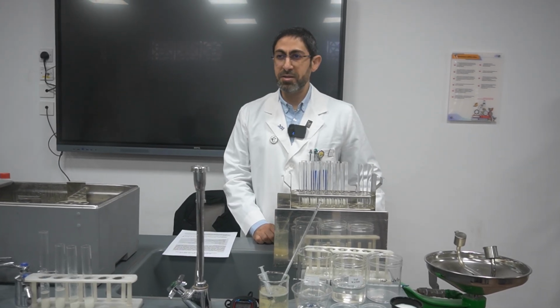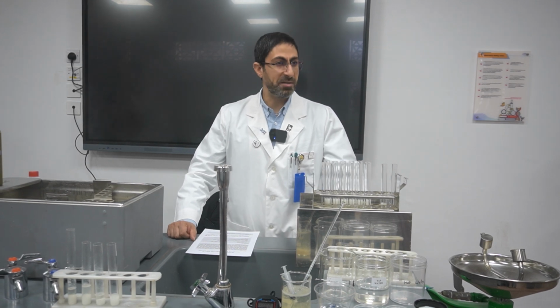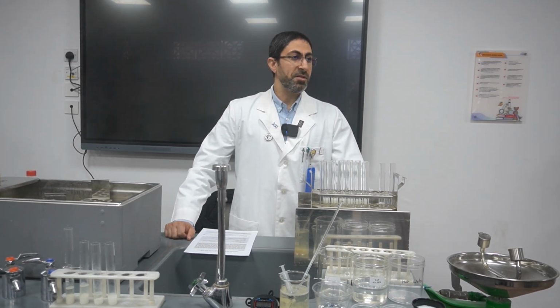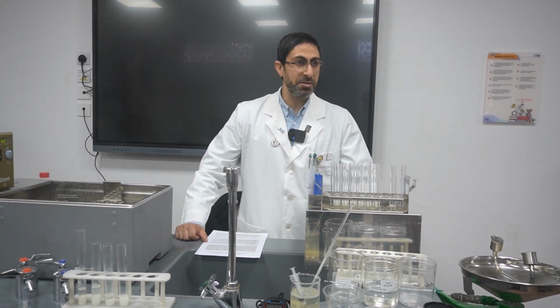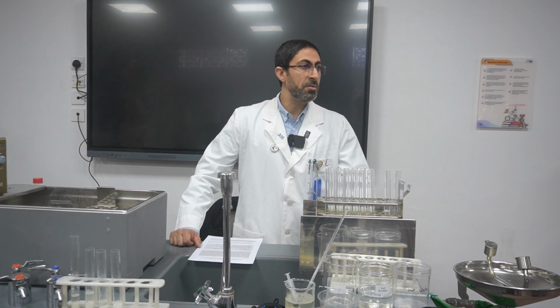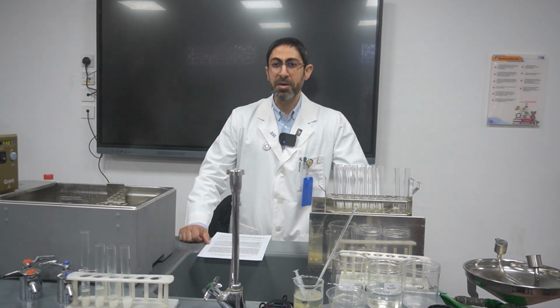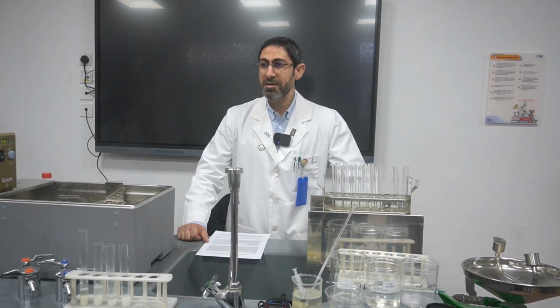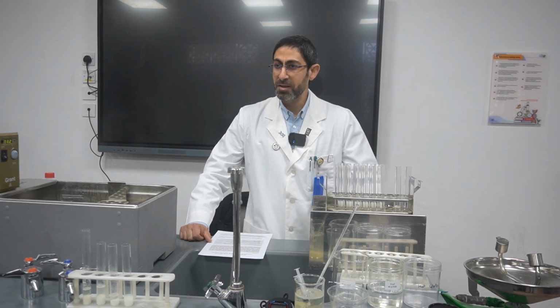Welcome, my students. Today we will be investigating the effect of temperature on enzyme activity. Our enzyme today is trypsin. Trypsin is an intestinal secretion that works on protein to break it down into amino acids. Today our protein sample will be casein, the protein found in milk.